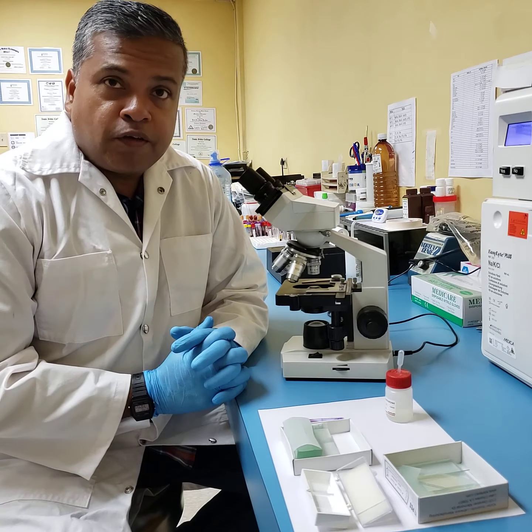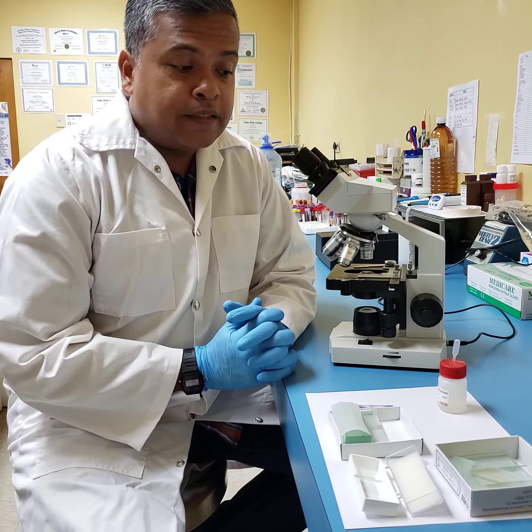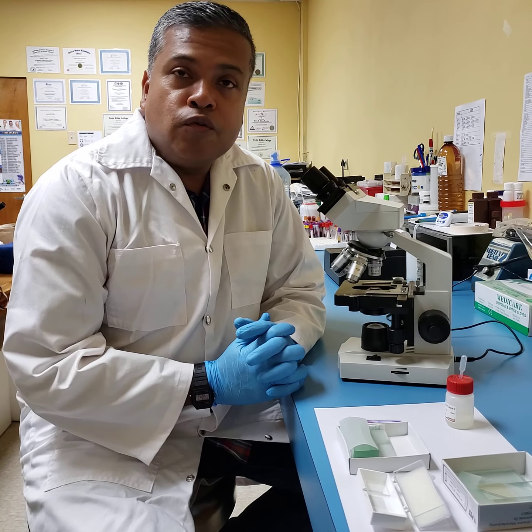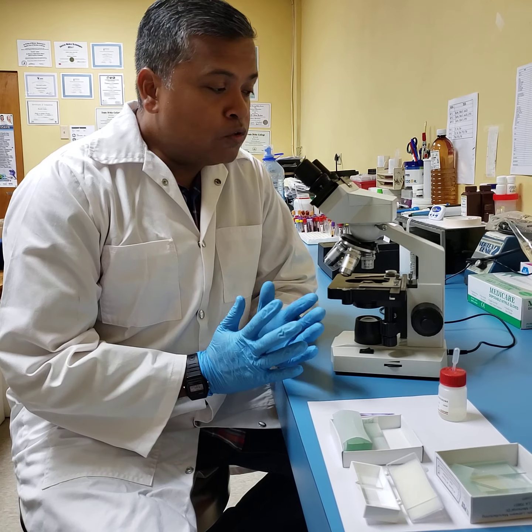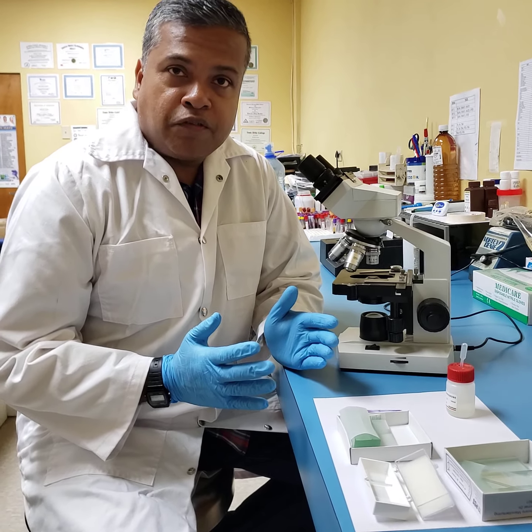Microscopes are very sensitive equipment. They are very easy to get out of alignment, and in an attempt to bring you up to par with a very important tool such as a microscope, I want to firstly introduce you to the basic anatomy of the microscope.